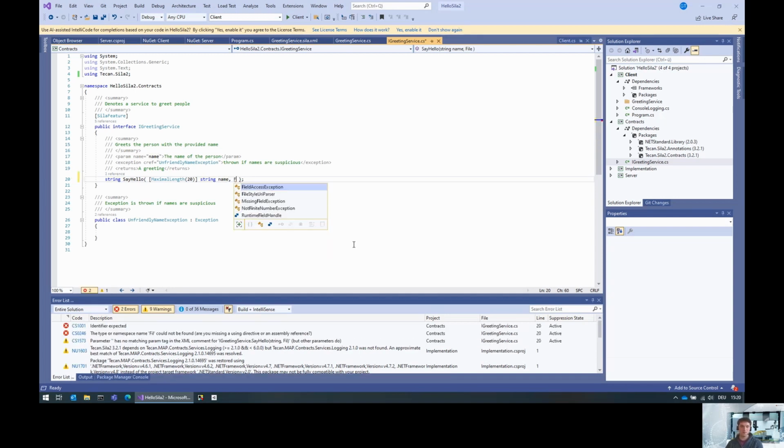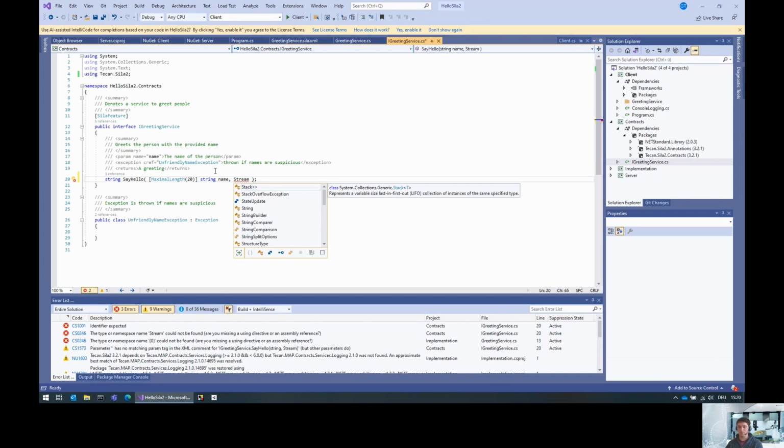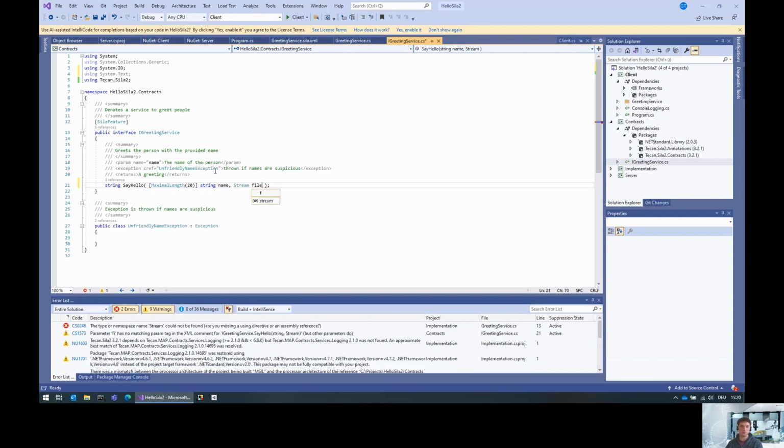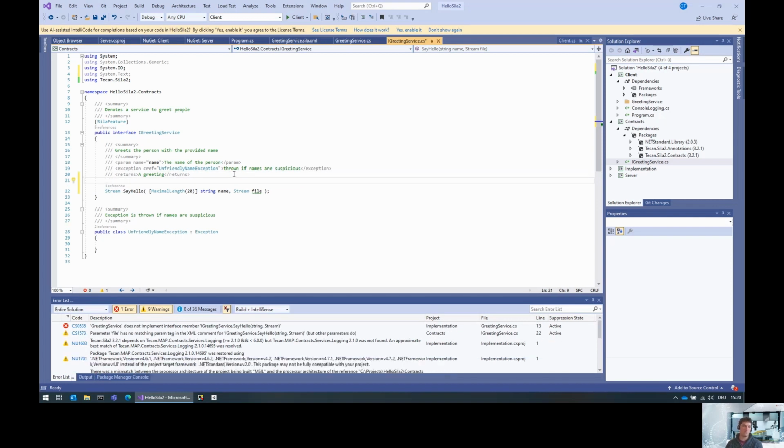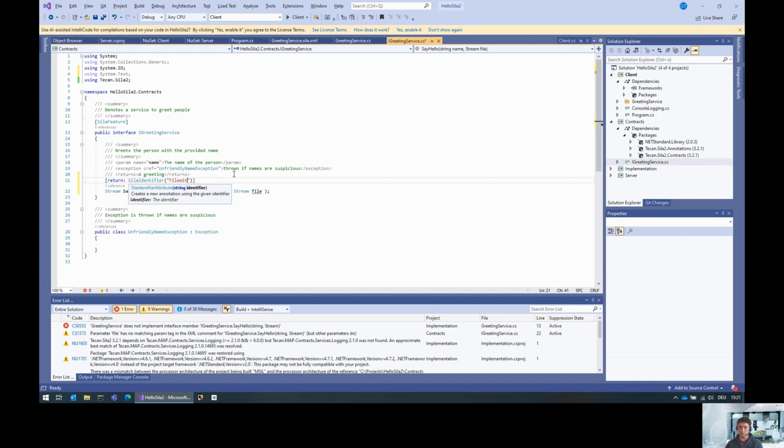Yeah, we need a second parameter. And I mean, here you can imagine that the string type maps to the basic type string. So what type would map to the binaries? There's actually 3 types. The default one is stream. I'll just take in a file as well and output also a stream. Okay. And because the return value doesn't really make sense for this thing now, I'm also going to change the identifier of the return value to say, okay, this is a file with greeting.